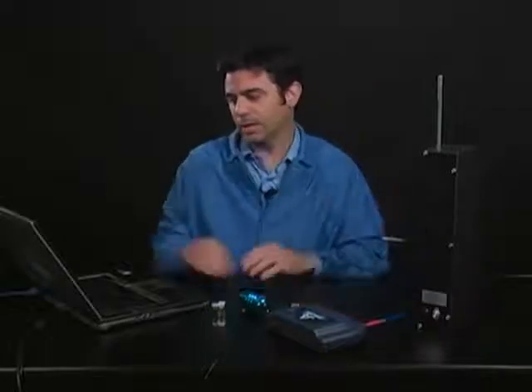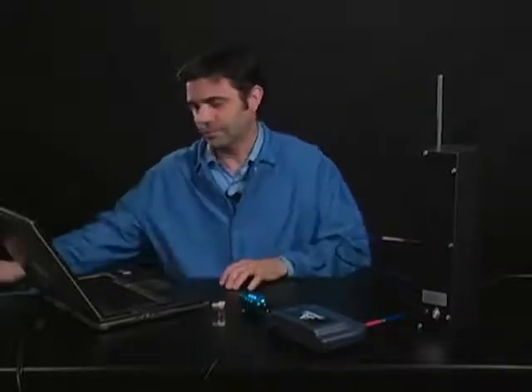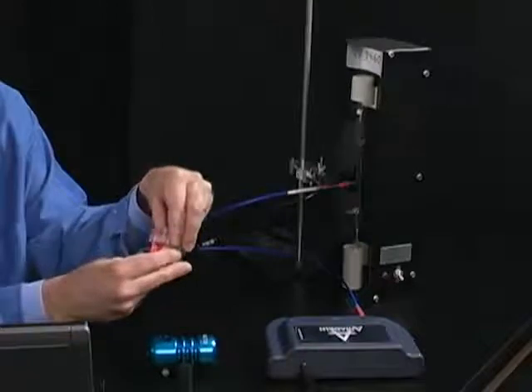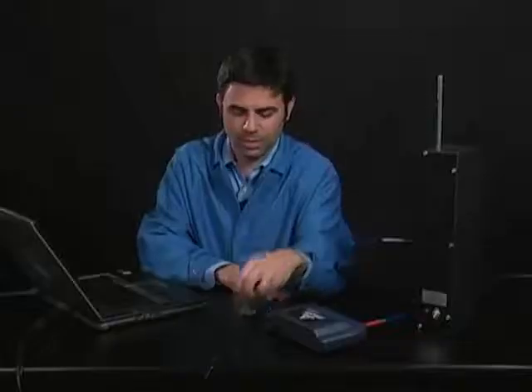Right, good. So we can look at emission spectra fairly easily, and we can do some analysis of those wavelengths. For chemistry, we also want to look at solutions. And so we have a couple of colored solutions. And we're going to look at why these are colored and what they're doing in terms of their wavelengths and the intensity, and then we'll also get into absorbance and transmittance.